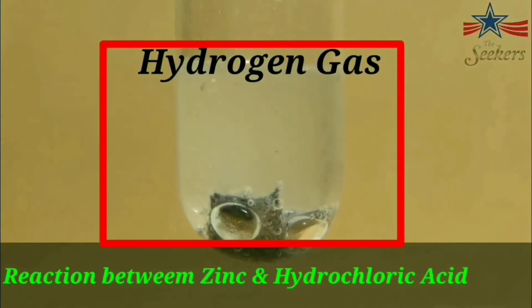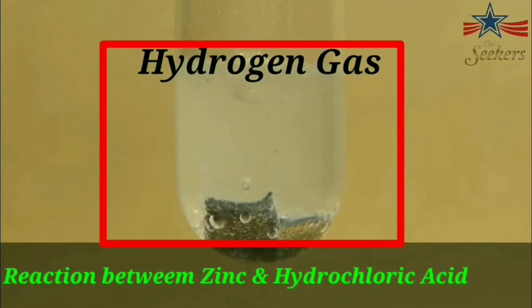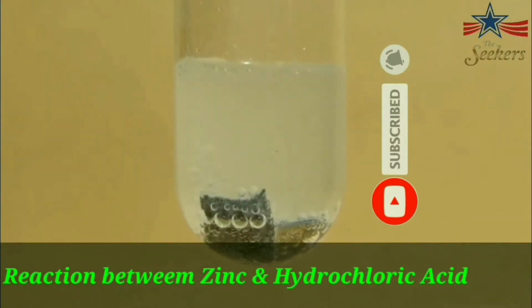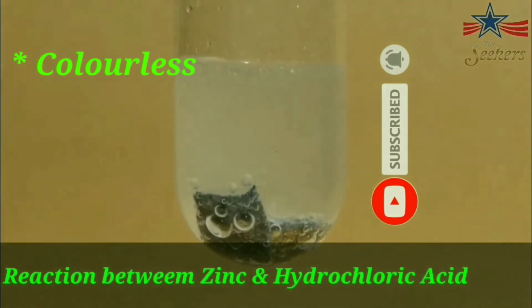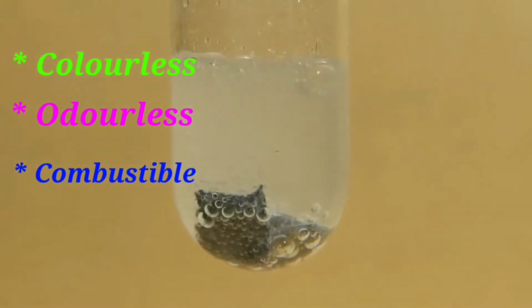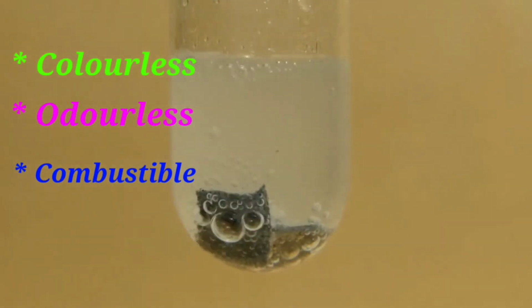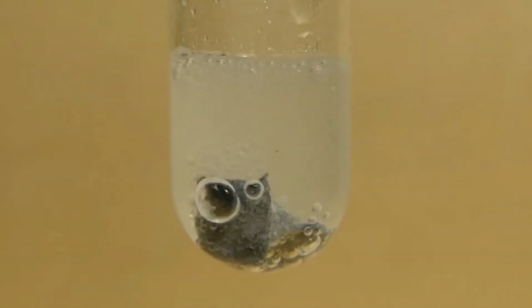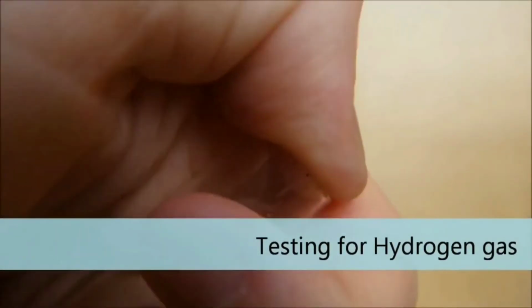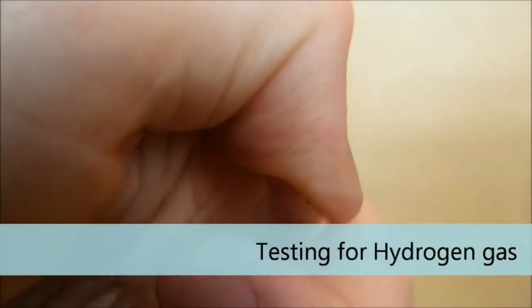Yes, it's hydrogen gas. Can you state any three properties of this gas? Yes. Number 1, it's a colorless gas. Number 2, it's an odorless gas. Number 3, it's a highly combustible gas. That is why we use the burning splinter test in order to detect the presence of hydrogen gas. When we take a burning splinter near the mouth of the test tube containing hydrogen gas, it burns with a popping sound.